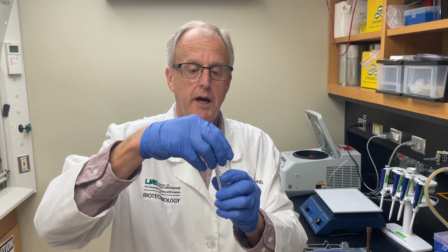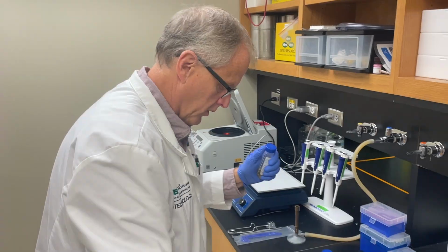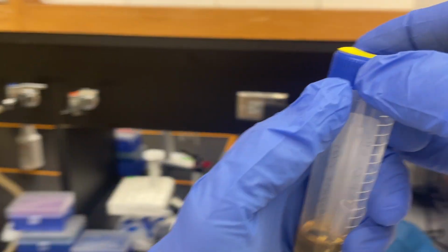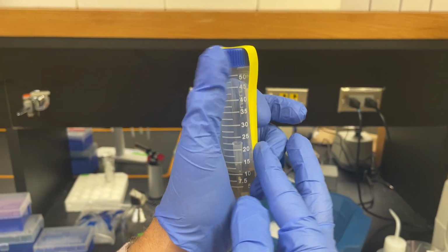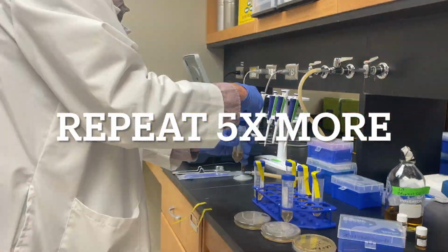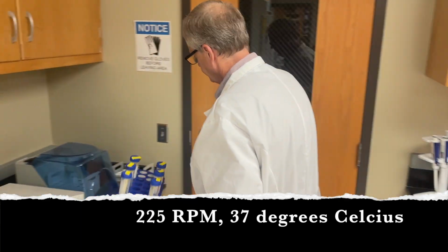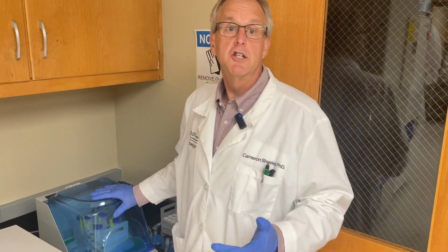Don't put the cap on too tight. Have it wiggle, so basically wiggle, wiggle, doesn't come off. And then we're going to tape it. Don't tape it all the way down. We want air to get in. I'm kind of with my thumb pushing it up, just pushing it up so it's not being pulled down, and just put the tape on to hold it in place. See, still moves. Put it in our shaking incubator. Now we just let it shake overnight.